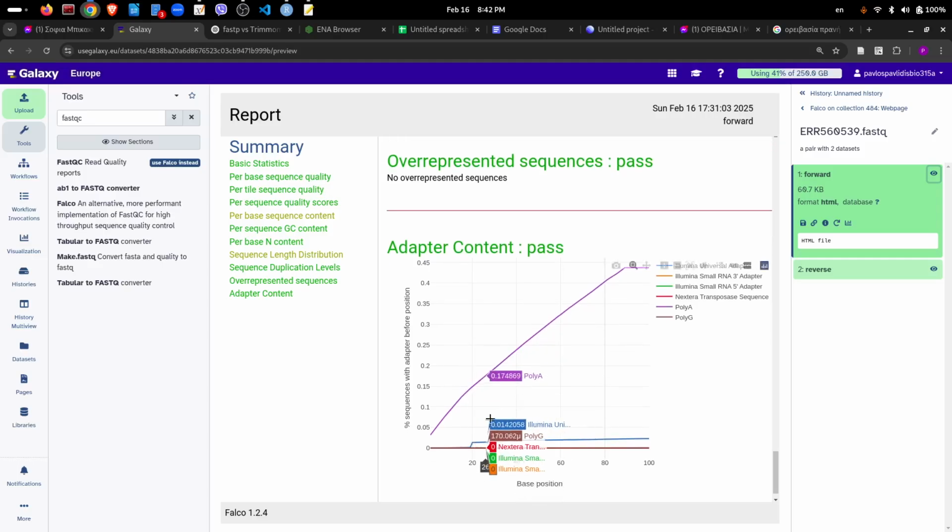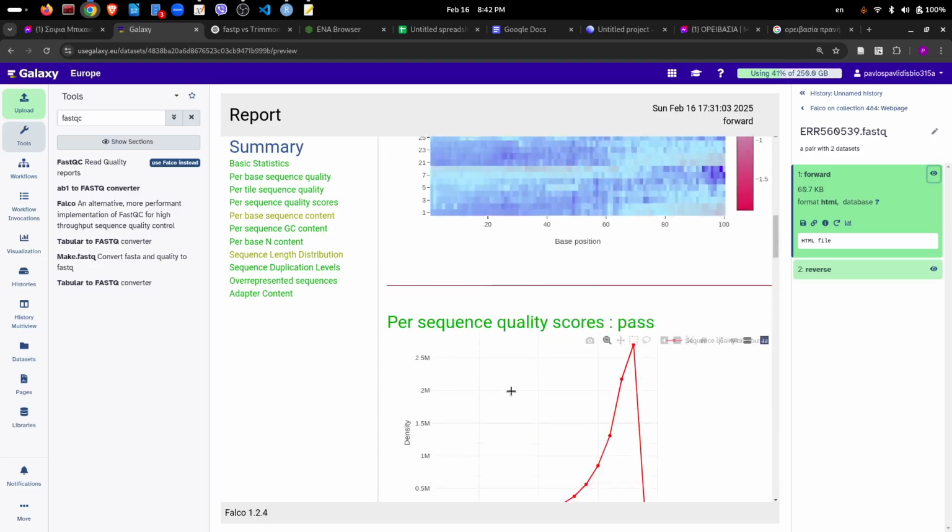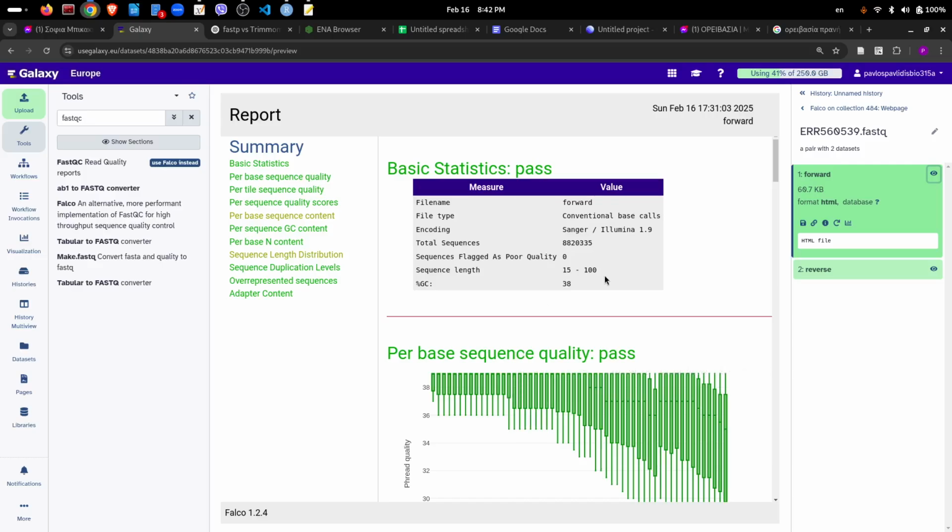So in general, we have cleaned for poly A, but still the percentage is small. We have cleaned for the adapters. Okay, so this is the quality of the reads after the filtering. We see also that our shortest read is 15 base pairs and the longest is 100. Perhaps we could put a threshold here and reject reads that are so short. We could maybe keep reads that are, I don't know, maybe 40-50 base pairs or longer. But since the yeast is a small genome, even 15 base pairs could result in a precise match.